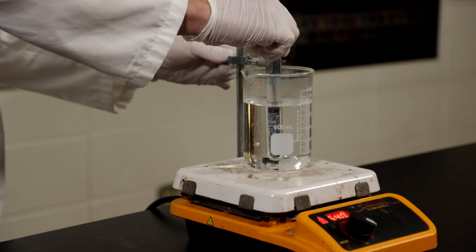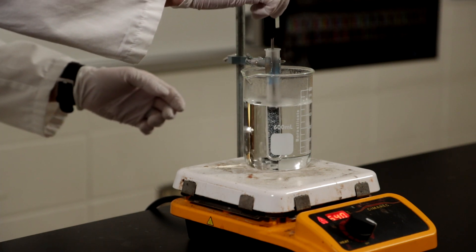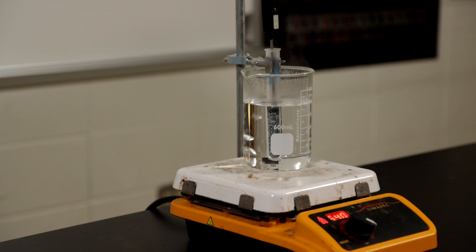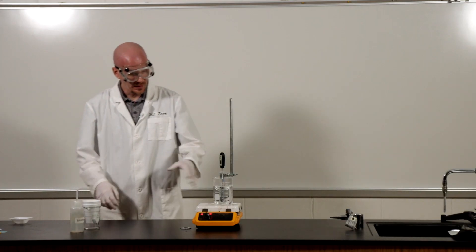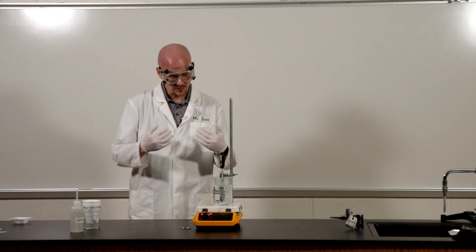And if you notice all of the metal is submerged now and I've got my temperature probe in there and the temperature is starting to increase so I'm going to let that sit for a couple minutes and we'll come back.